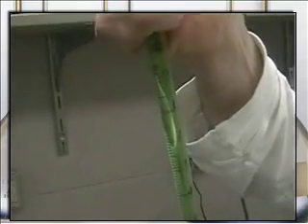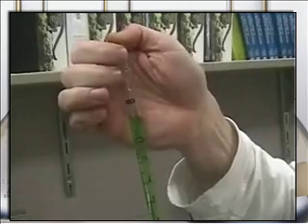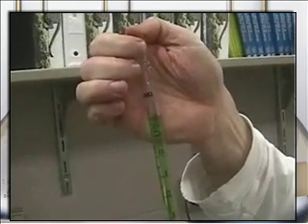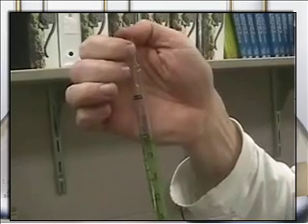So now I'm not going to take my thumb off, although it will flow real fast. I am going to just release some pressure. I'm going to try and do this without, usually I have my hand over and you can kind of see the liquid going down very slowly. Notice my thumb is not off, it's just releasing the pressure.